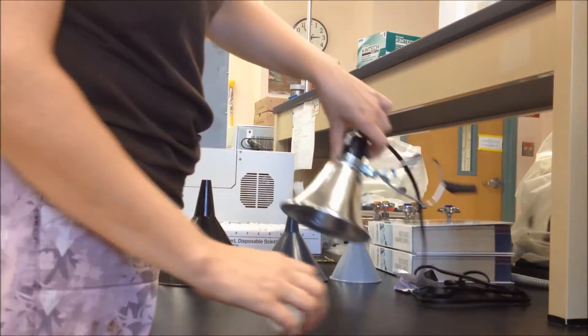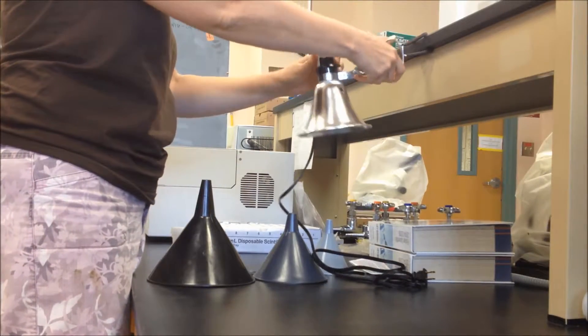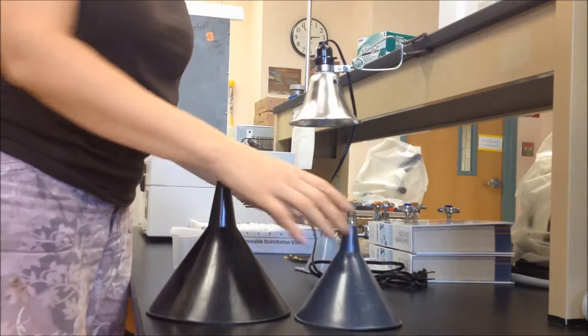Screw it into your lamp and then attach your lamp to something sturdy: an edge of a bookshelf, a ring stand, a table edge, whatever is going to hold it up above your sample.